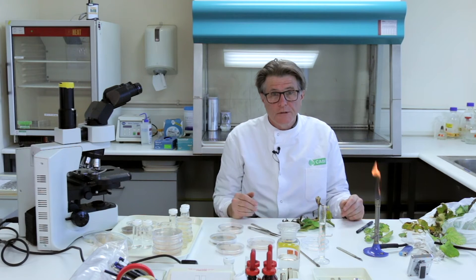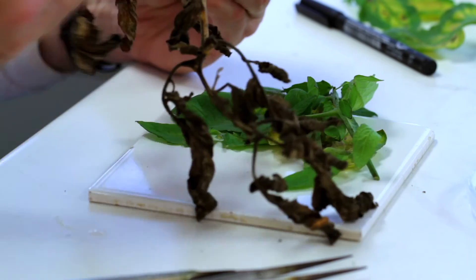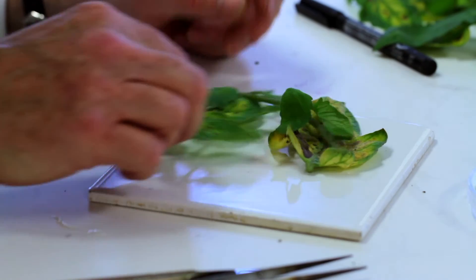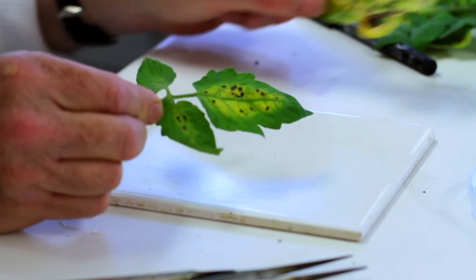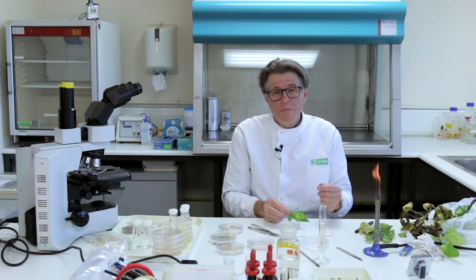To isolate the pathogen, we need to kill off most or all of the opportunists before attempting to culture the pathogen. We do this by immersing the material in dilute bleach for a few minutes and then washing the bleach off. It's very important to select your symptoms correctly. You don't want tissue that is far too dead — completely overrun with saprobes. The pathogen will be there in very short supply, possibly not even there at all. What you want is very new symptoms which are just developing, such as little leaf spots just forming, because this is where the pathogen will be growing most actively and won't be overrun by saprophytic organisms.